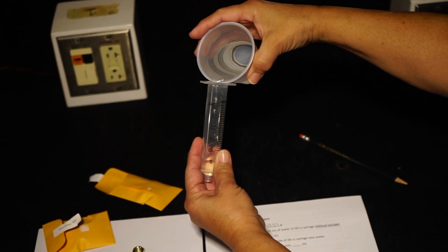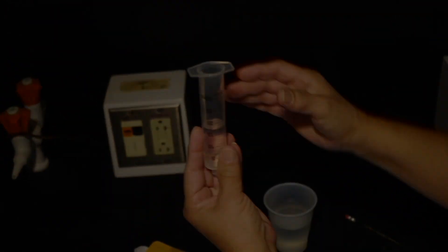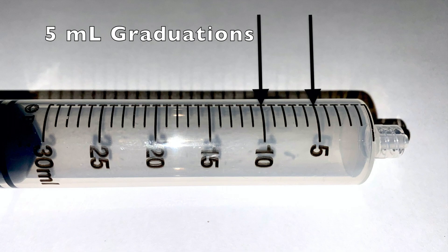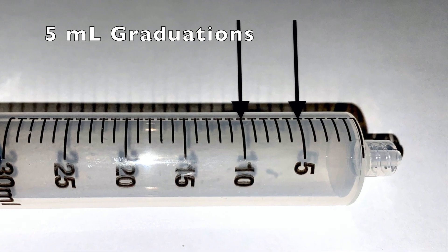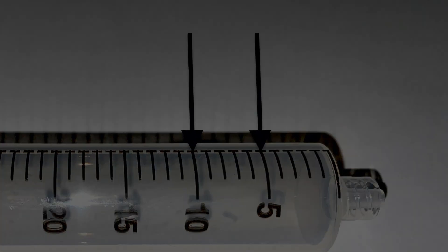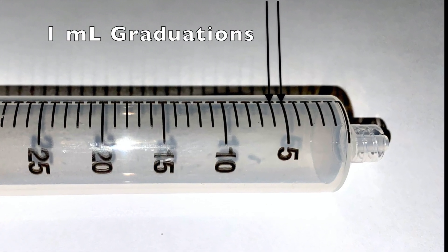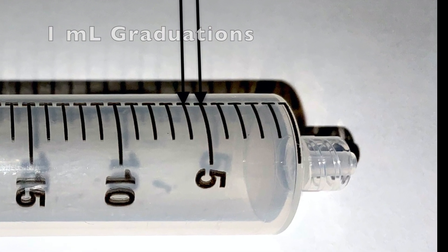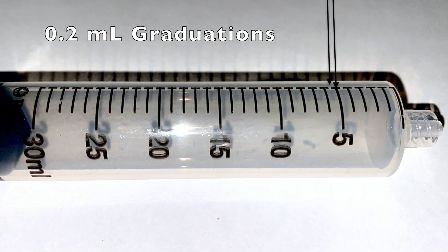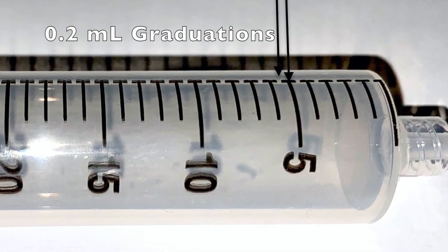Remember to read the graduations properly. The largest graduations are 5 mils, the small graduations are 1 mil, and the smallest increments are 0.2 milliliters.